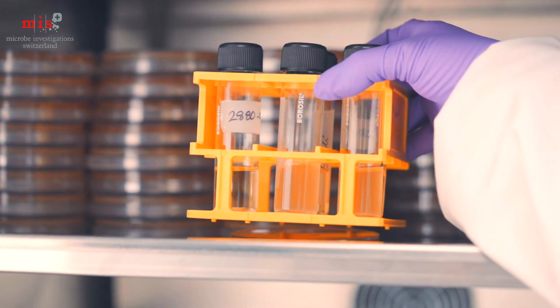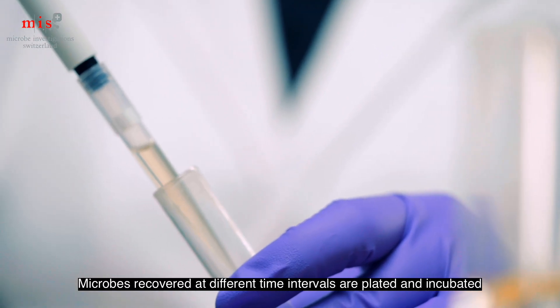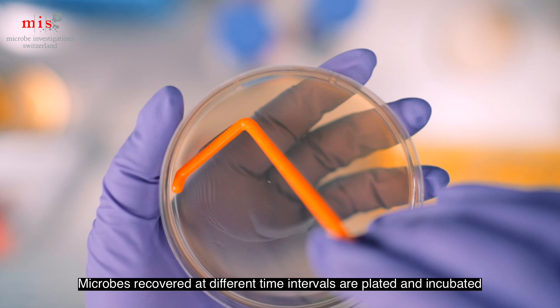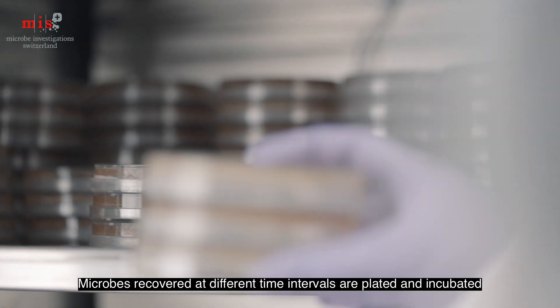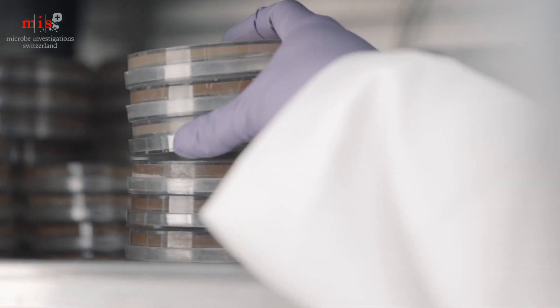Incubated samples are recovered at 7, 14, and 28 days. The recovered incubated samples are then subjected to serial dilution, followed by plating and incubation to enumerate viable test microbes.